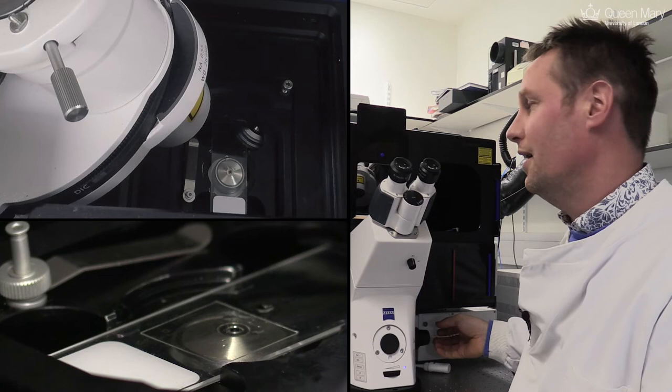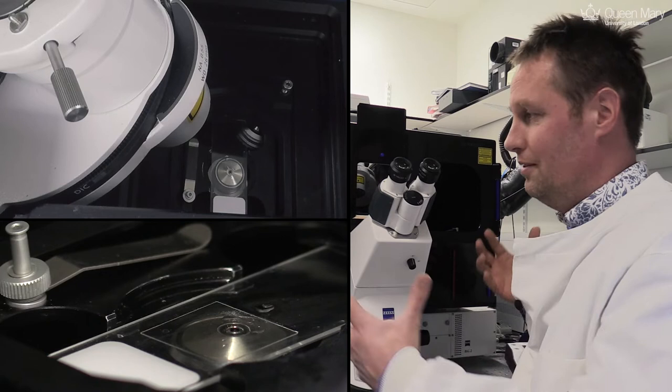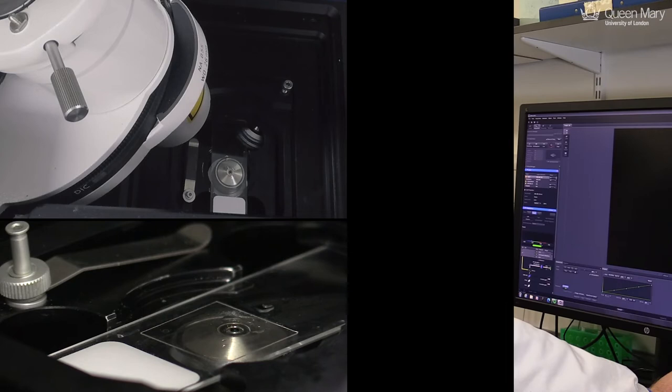We can focus by bringing the objective up and down, closer or further away from our sample. And then we'll use all the mechanics of the machine to take the image with the computer.